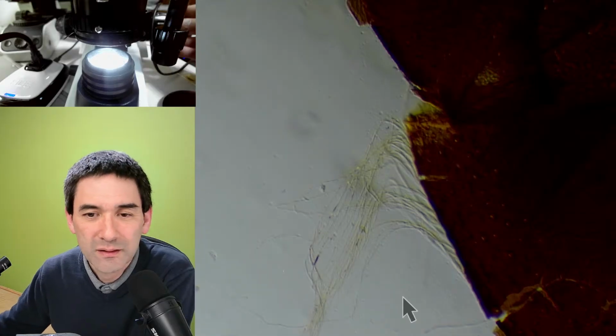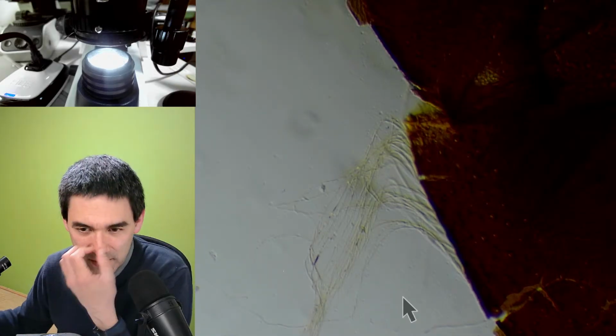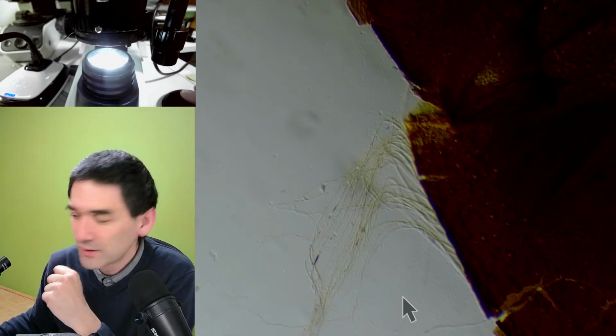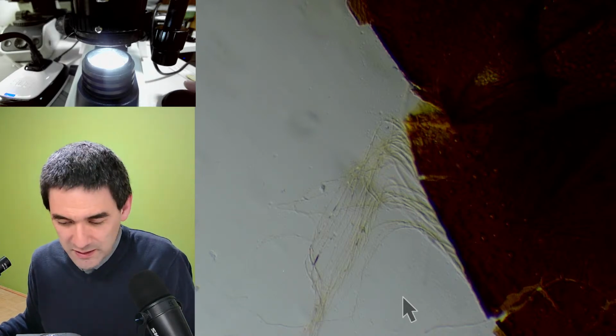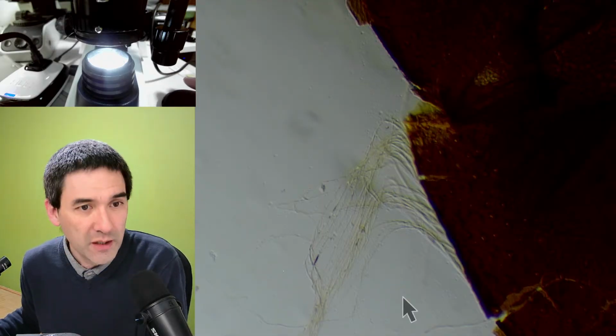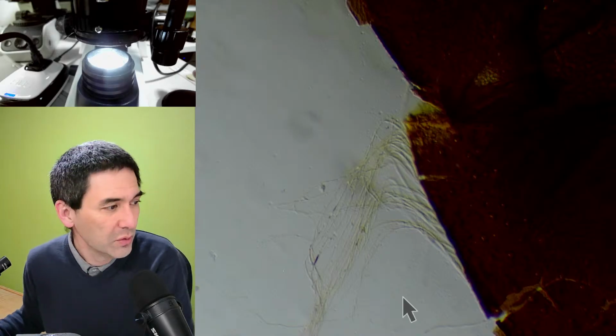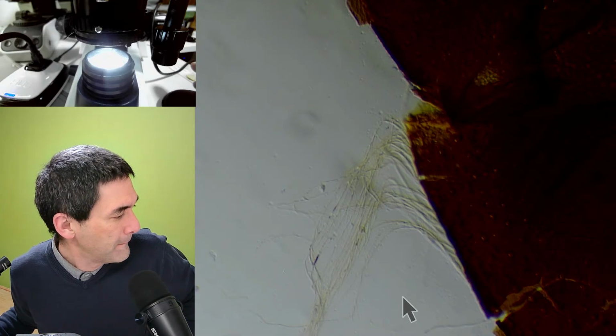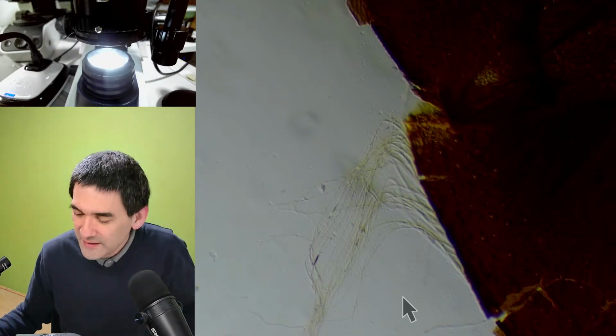So, I'm checking the time. Okay, it's almost 1 hour again. So this is basically something I wanted to show you. What we can try to do, because I try to do this every time, is to look at some live specimens. You know what? I've not tried this yet. Honestly, I really did not try it yet. Let's try that. Let's have a look at some of the nematode worms.